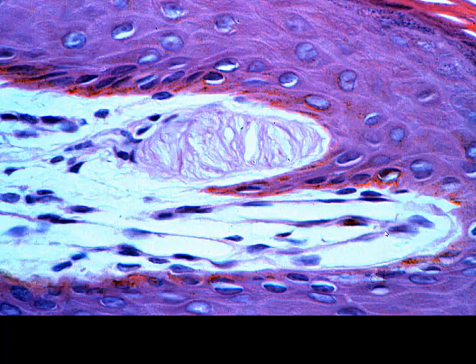Now this is the high mag shot of one of those epidermal papillae projecting upward in this direction. This is a dermal papillae projecting up, epidermal papillae projecting downward. This is another one projecting downward. And again, this reminds me of an elongated big mitochondria. You can see these layers inside. That is going to be our Meissner's corpuscle that you're going to see in this location.